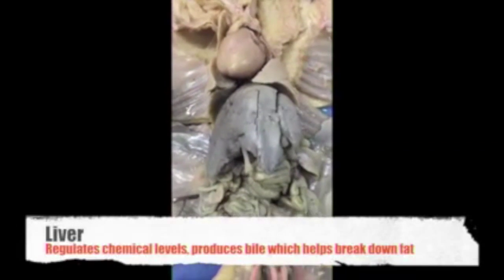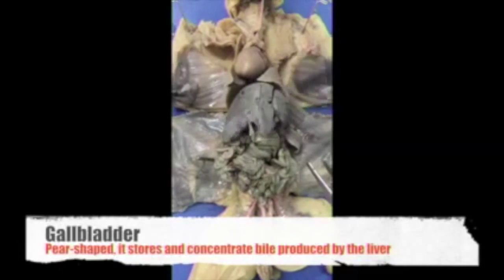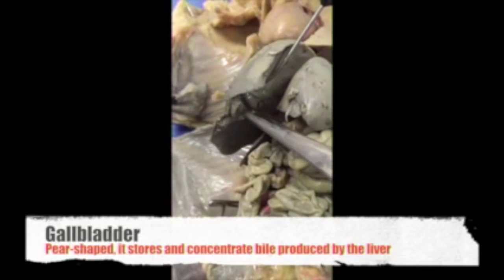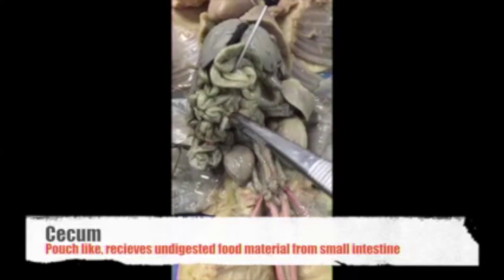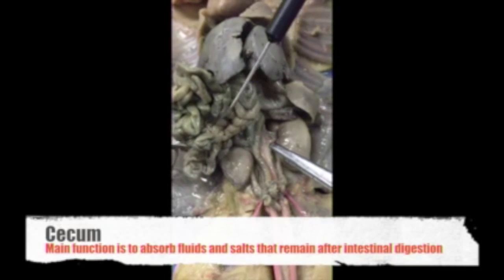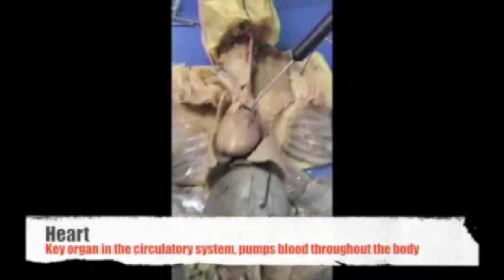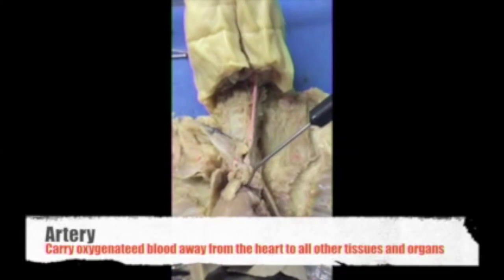Then we have the liver, this right here. Then under the liver, we have the gallbladder that is right here, this little sac. Then we have the cecum, this is the cecum right here. Okay. This is the fetal heart. This is an artery that branches off the heart.